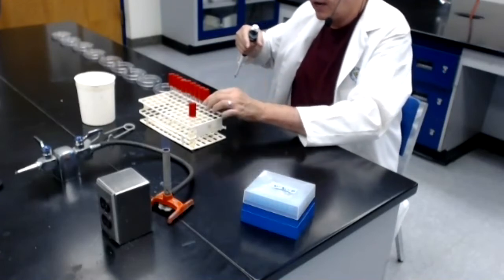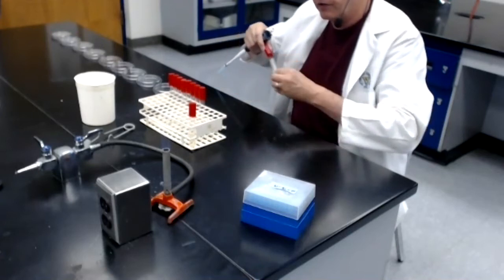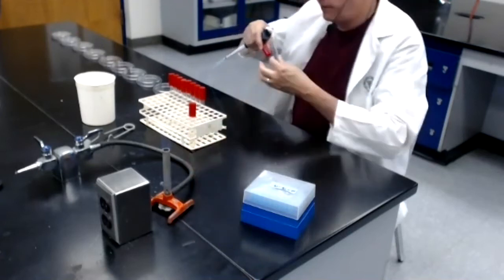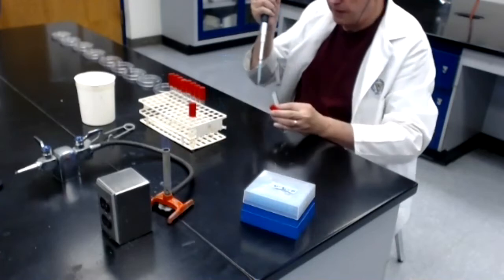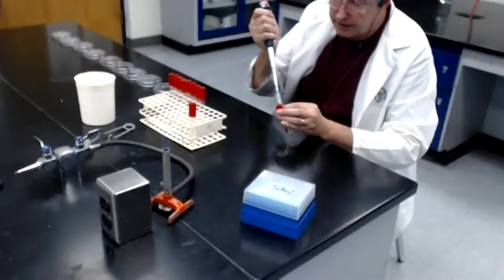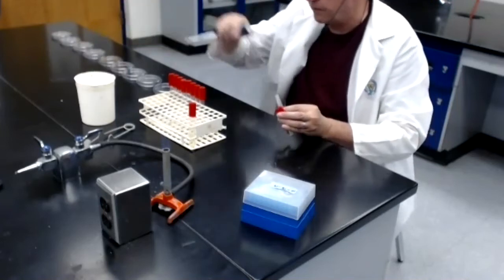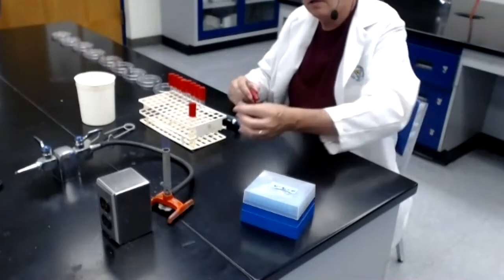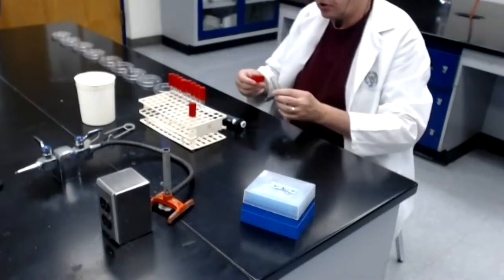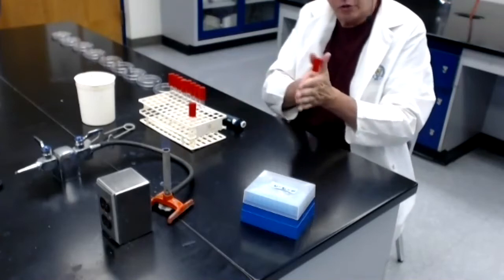because I don't want to accidentally pick it up later on in the protocol. I now take tube number 2, which is labeled 100th dilution, remove the top, flame the mouth, and now I dispense the 1 mil that is in the tip into this tube. Dispose of the tip. I put the micropipetter down, flame the mouth of tube number 2, the cap back on, and now I'm going to mix tube number 2.